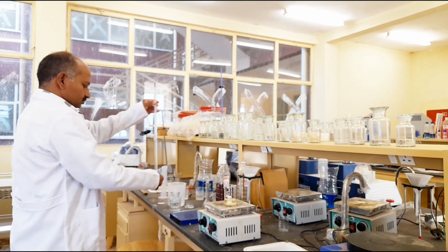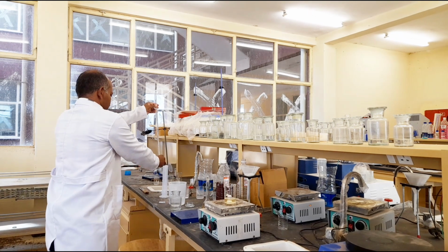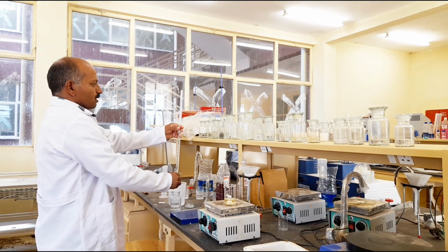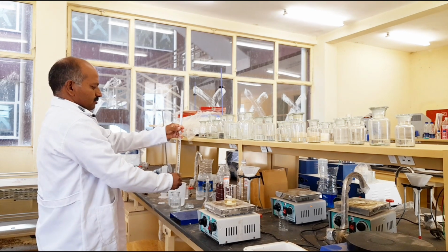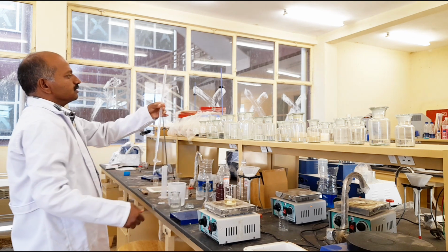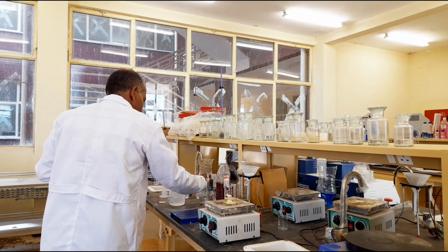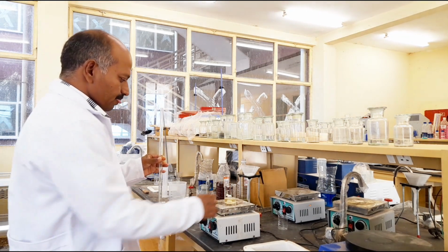So this is excess. I am making it up to the mark. Yes. Now it is up to the 0 mark. So now this is ready.